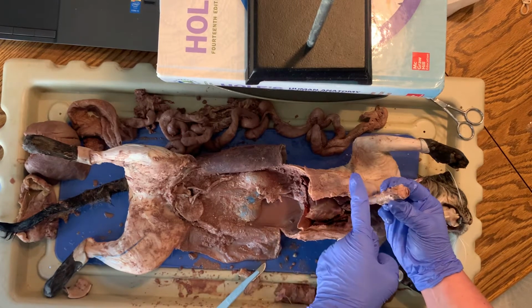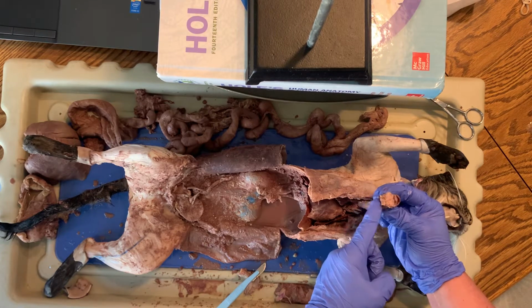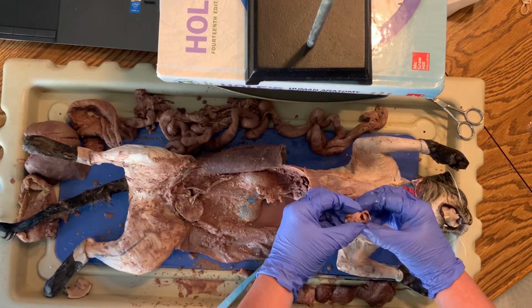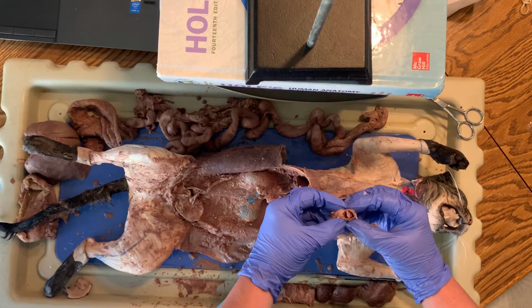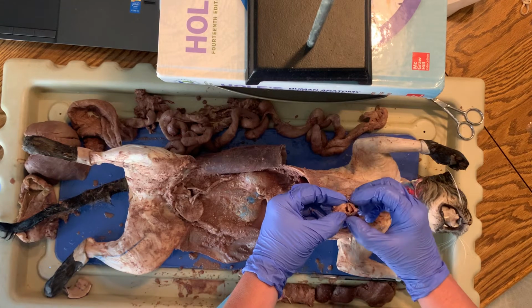When you touch your neck and it goes like that, you're hitting on your trachea with your voice box because your larynx and your vocal cords are in there. That's this front opening here. The back opening here, that's the tube, that's the esophagus. So when you swallow food, it's going down there.